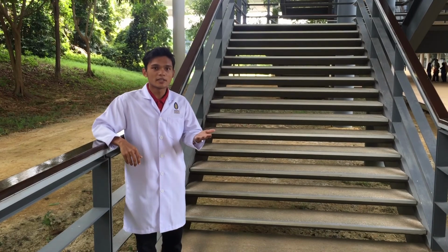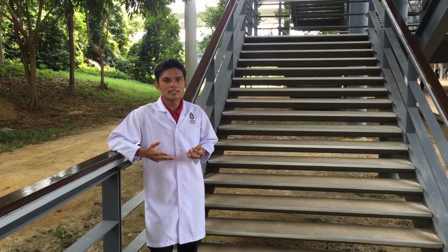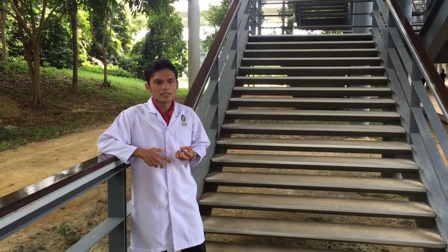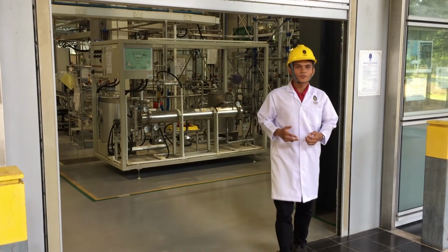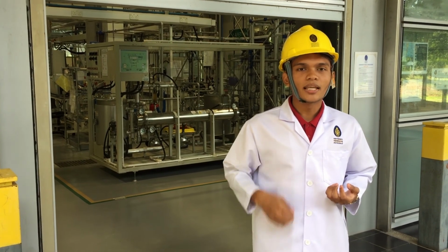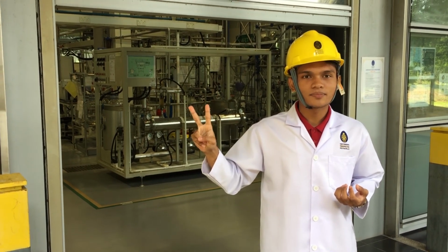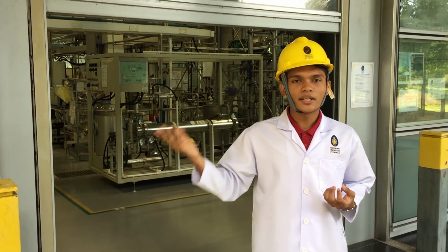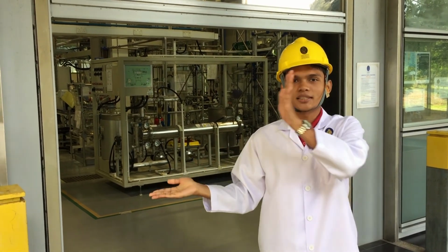In this experiment, we will do a saponification process, which is a process where fatty acid and sodium hydroxide react together to get our desired product. The chemical equation is shown below. In our experiment, our aim is to determine the order of reaction and the rate constant. In general, there are three orders of reaction, which are zero order, first order, and second order. These orders of reaction can be differentiated by the rate law and integrated rate law, as shown in the table here.